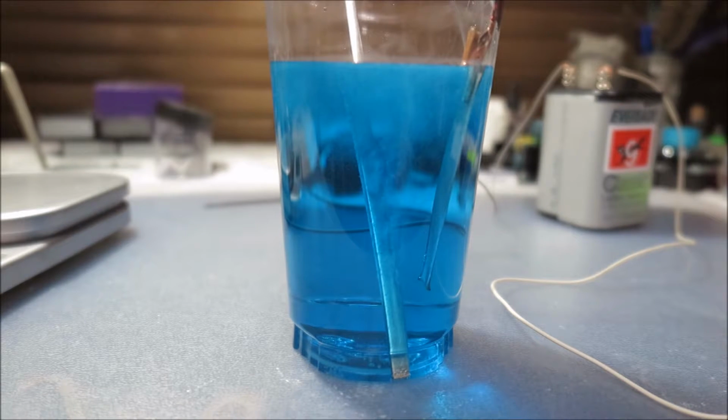So this is a very clear liquid, and I'm instead using a metal chopstick, and it works very well. But I think it'll turn black soon enough.